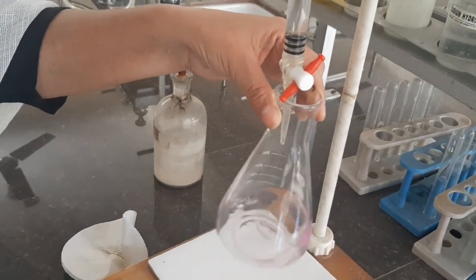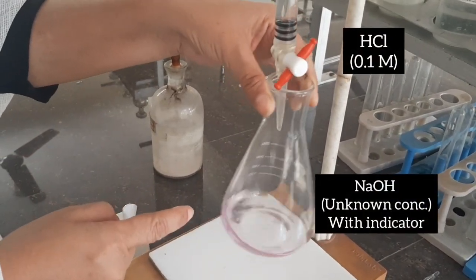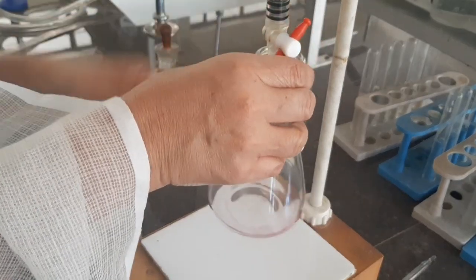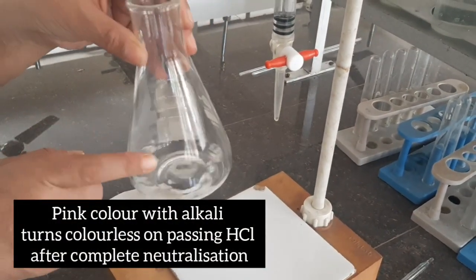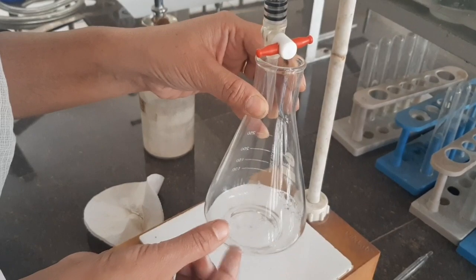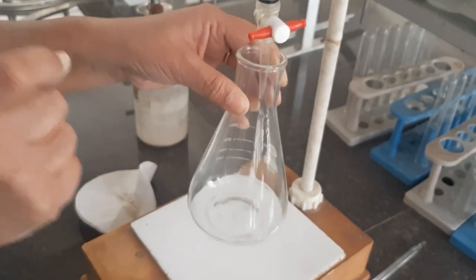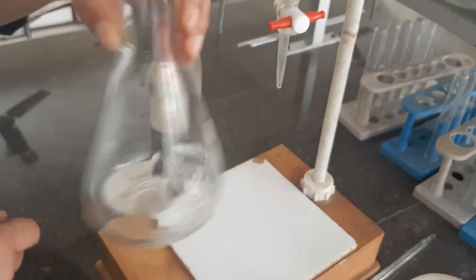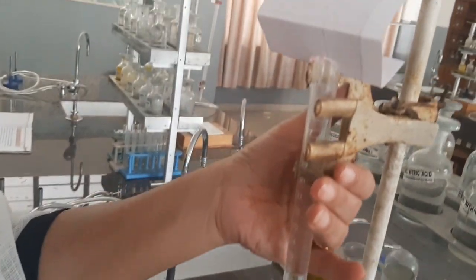Let the liquid in drop by drop until the solution turns colorless. The solution is pink because phenolphthalein shows pink color with alkalis. As we add HCl, it reacts with sodium hydroxide, tending to make the solution neutral. When the moles of HCl added equal the moles of sodium hydroxide, there is complete neutralization. One more drop of HCl makes the solution acidic, and phenolphthalein becomes colorless. The solution has now turned colorless — take the final reading.